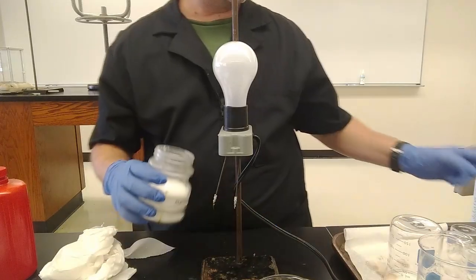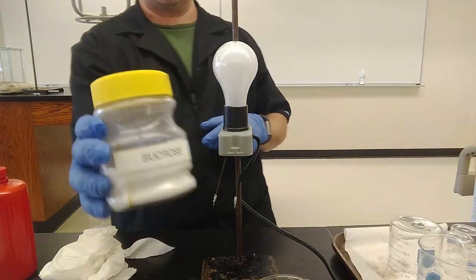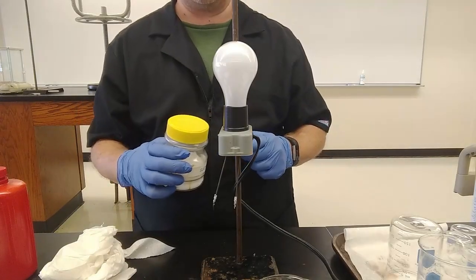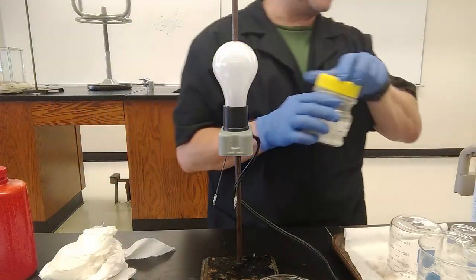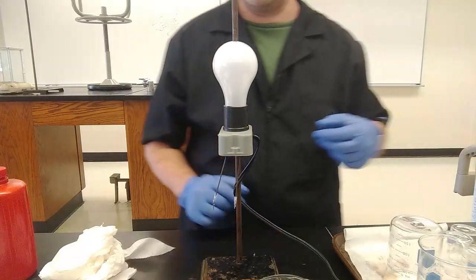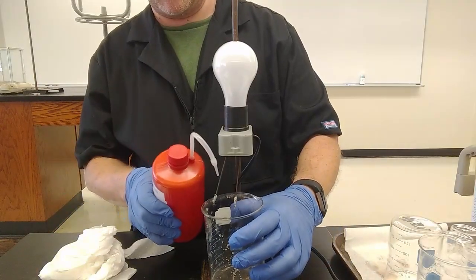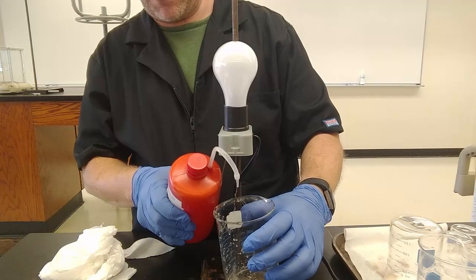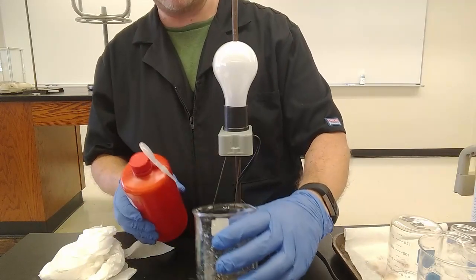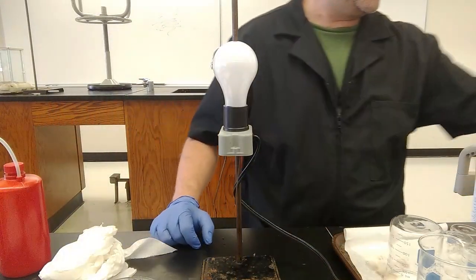At the atomic level, there are huge spaces between the particles of this sugar and that sodium bicarbonate and that table salt, and there's no way an electron can hop across that huge distance. So it doesn't matter what it is. If you test it as a solid, you cannot determine if it is an electrolyte or not. So there's no point really in testing solids. I don't know why I put them in the lab manual, but just to make this point, you've got to satisfy the definition if you want to test it.